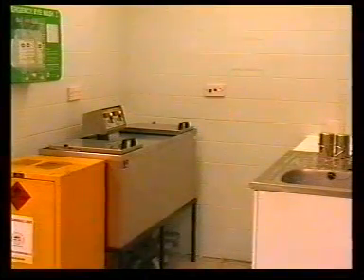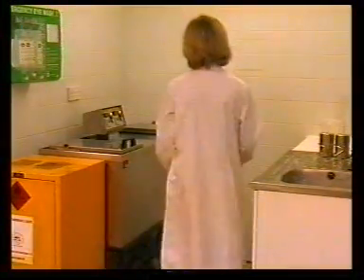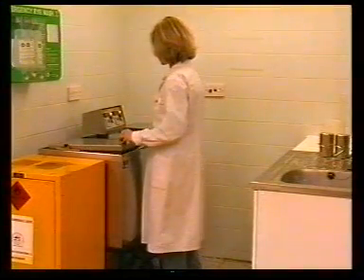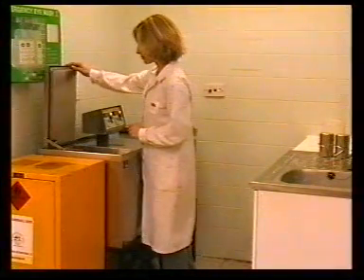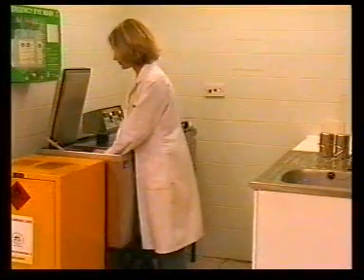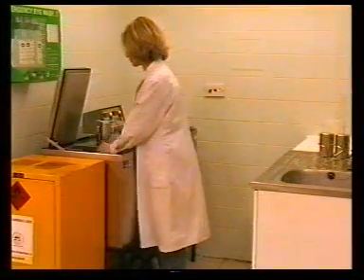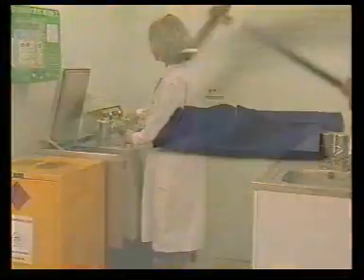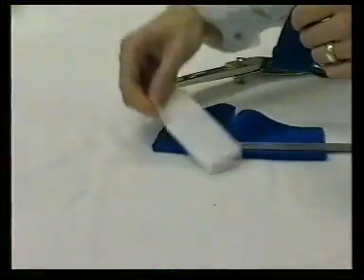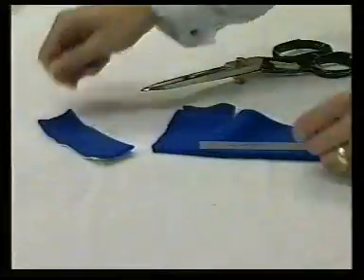The colourfastness to washing of a textile material is determined by treating a test specimen in a specific detergent at a specific temperature and liquor ratio for a given time. The specimen is attached to a standard multifibre strip so that the colour staining as well as the shade change can be assessed.